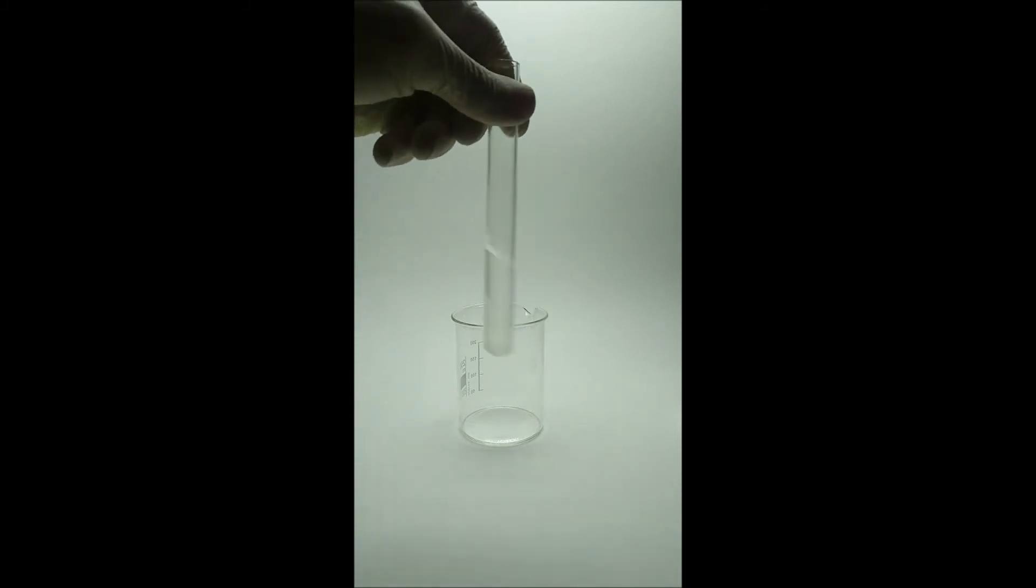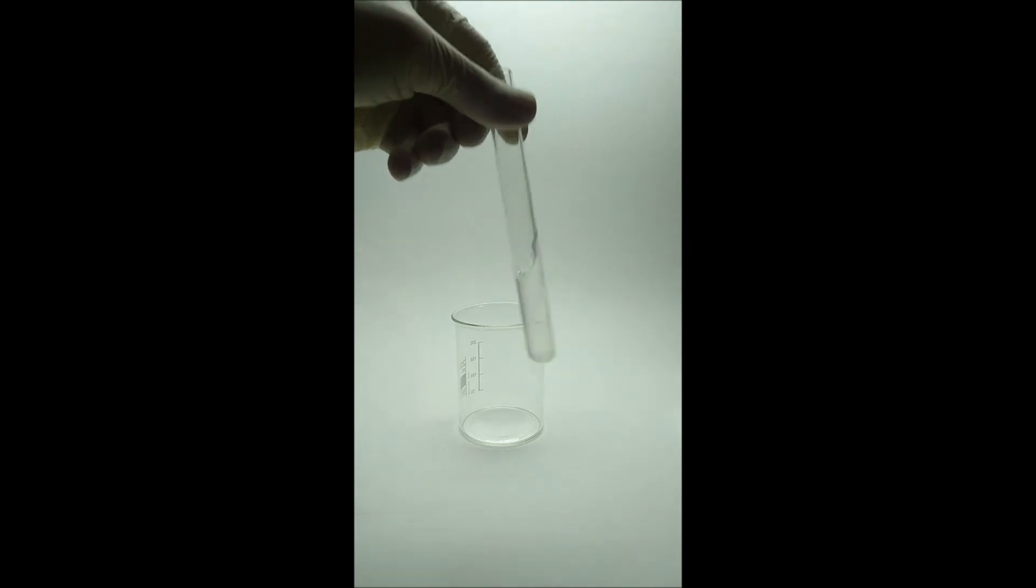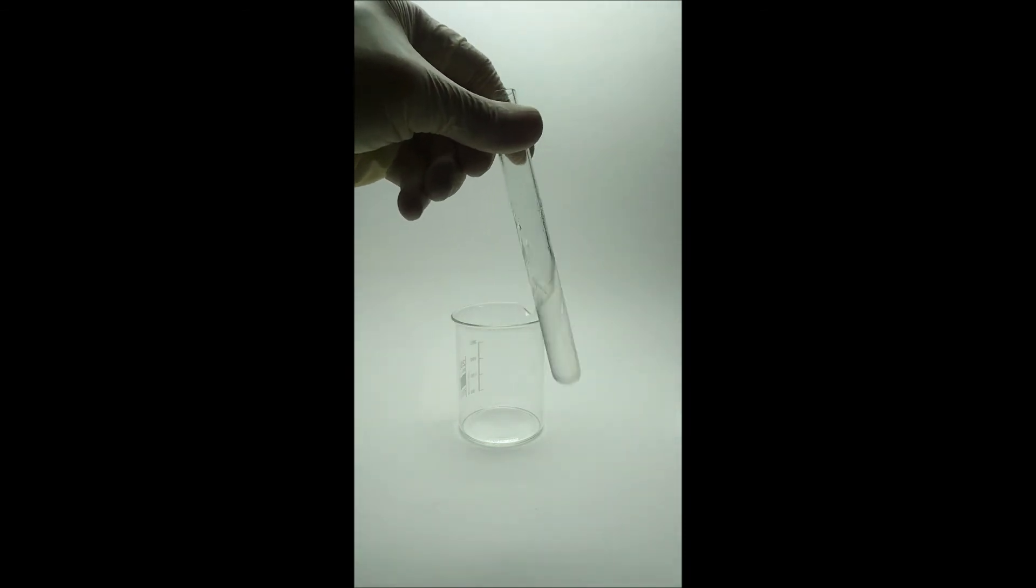You will be able to see clear separation between two layers. The top layer is the banana ester.